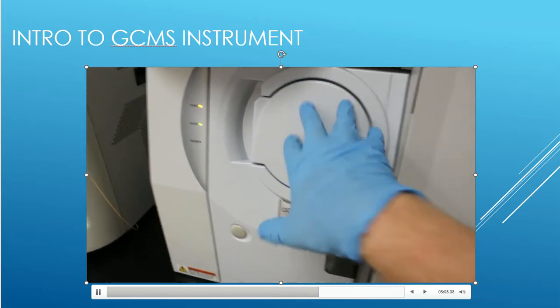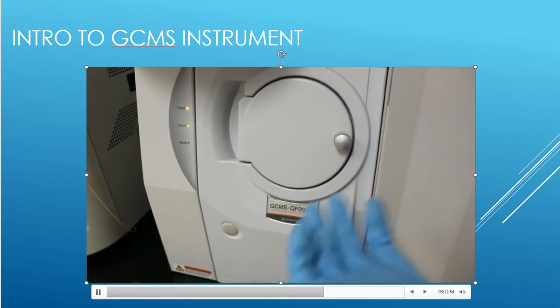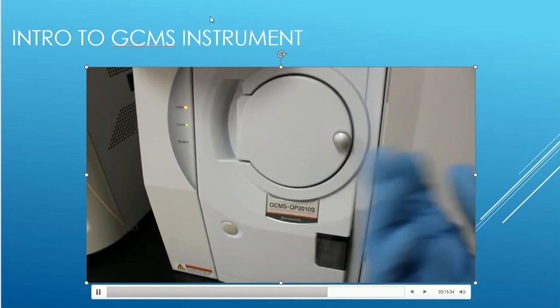So in the mass spec, that's where the fragmentation is happening. That's where the compounds are breaking up into the fragments and the pieces and the parts. That's where the teeth are for the molecule.